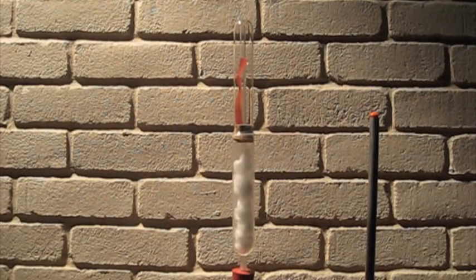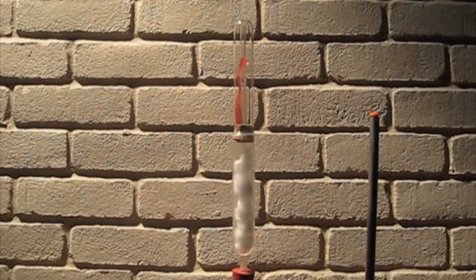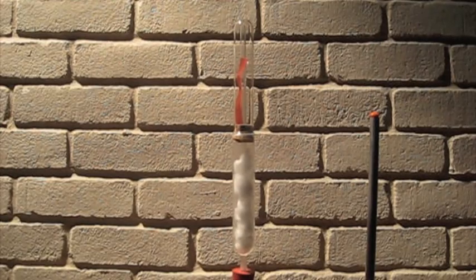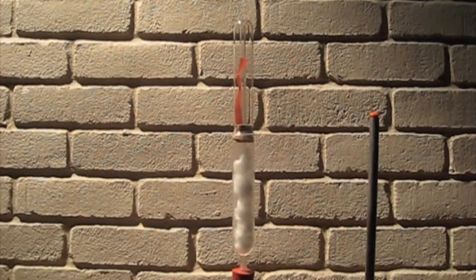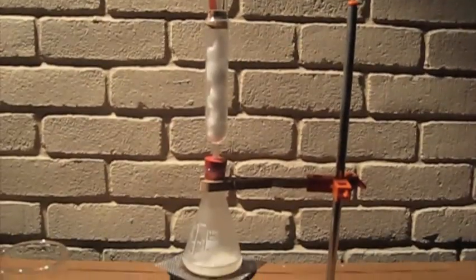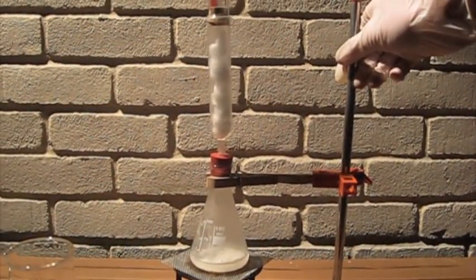This is attached to another test tube with a piece of red litmus paper in it to indicate when ammonia gas is formed. Ammonia gas will form ammonium hydroxide in the presence of water, which will turn the litmus paper blue.